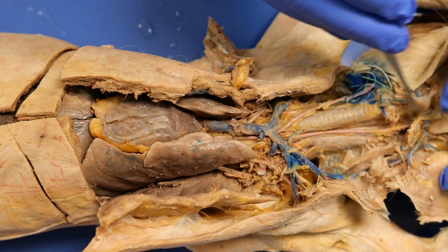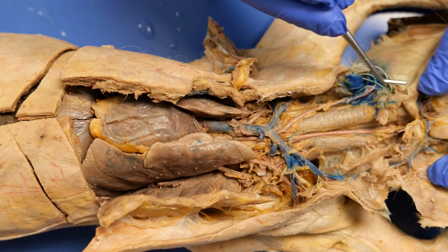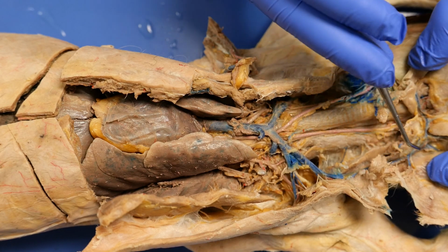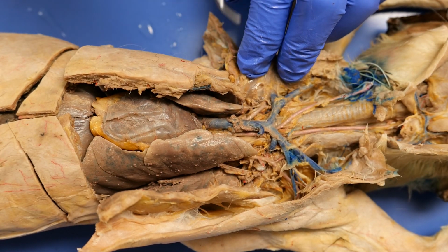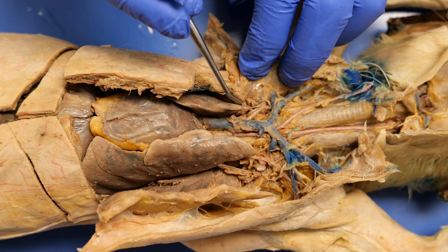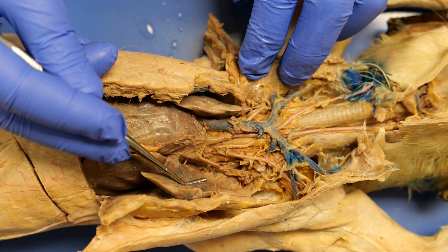If you look here, you will have this landmark right there called the transverse jugular vein, and the veins are much easier to see than the artery. But if you just take the roadmap and memorize it, you're then only looking at what are the branches coming off. And if you do that, this becomes much simpler. Good luck.